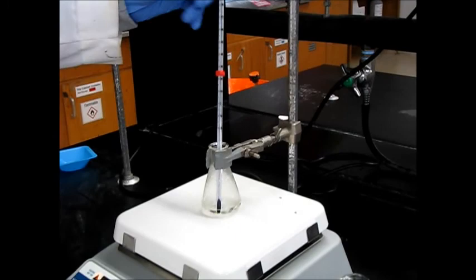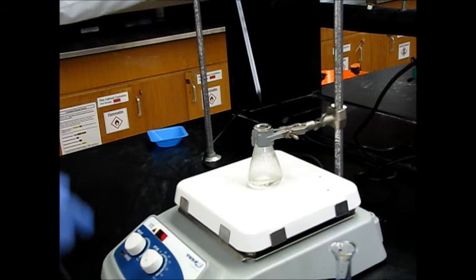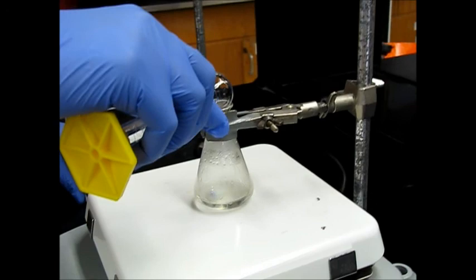All right. So it's been heated for about 10 minutes now. It's still like 87. So now what we're going to do is add two milliliters of water to quench this reaction.